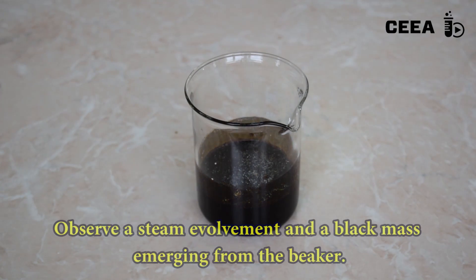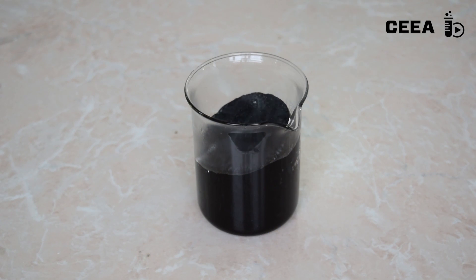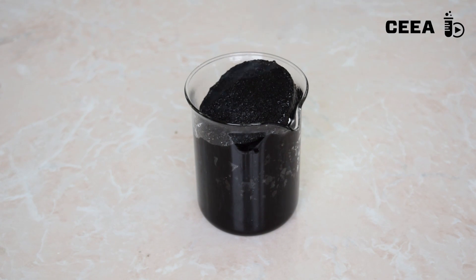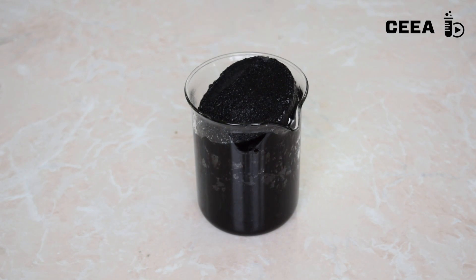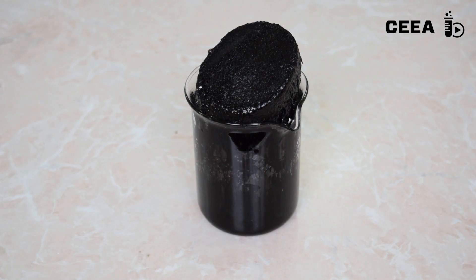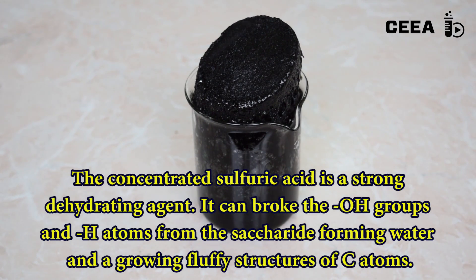In a few minutes' time, the black mass will start expanding and it grows two times taller than the beaker. This is due to the strongly exothermic process of sulfuric acid dilution with water coming out from the breaking saccharide. Steam is formed which expands the remaining carbon.